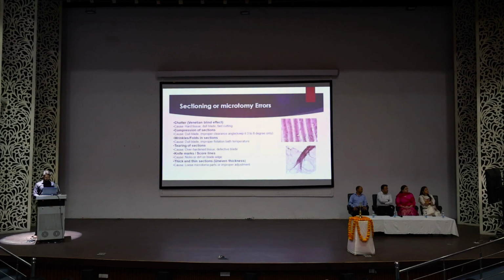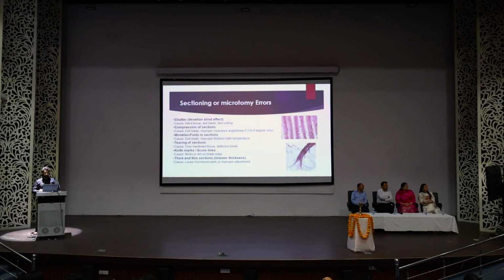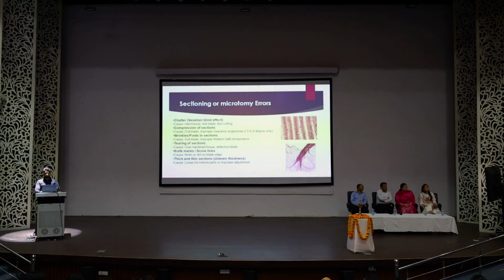The other problem we face is tearing of sections. The most common cause is overhardening of tissue or defective blades. Another problem is knife marks or score lines. They are usually caused by dirt particles present on the front side of the blade, or hard tissue, or the tip of the forceps while taking the section. You can see here, this is an image. You can see a fold here. This has happened because of low temperature in the tissue flotation bath.